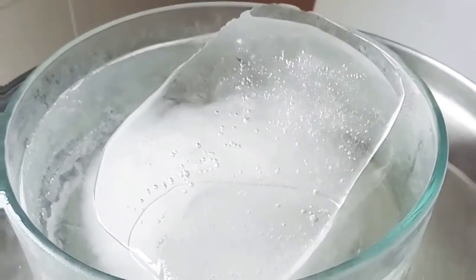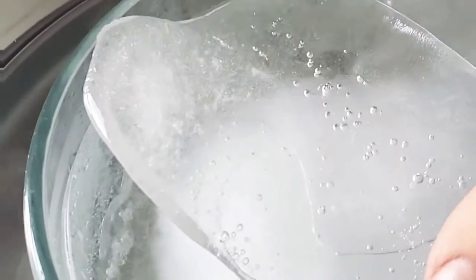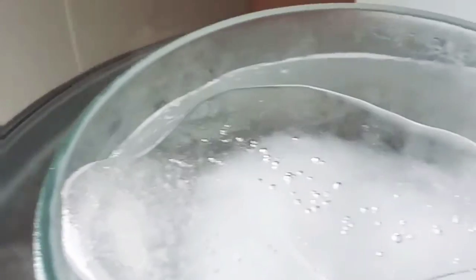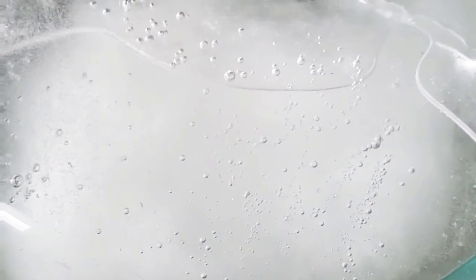I had a little bit of difficulty with the bags and decided to switch over to frozen ice in a bowl — one of these heatproof and cold-proof bowls. I've got a couple of other bowls I froze as well: here's one, a regular cereal bowl kind of thing, and here's also a thicker container. This might be a better idea than using bags — you live and you learn.